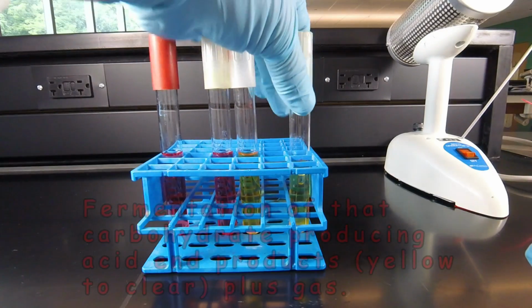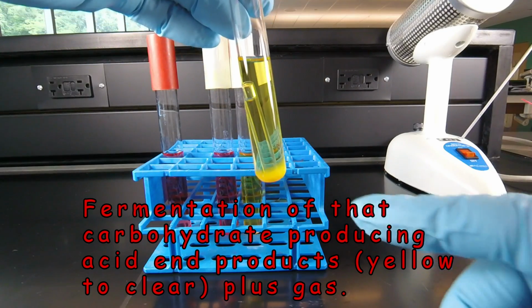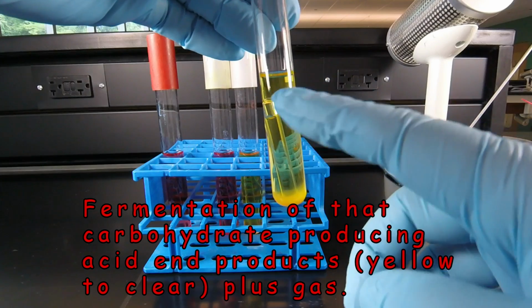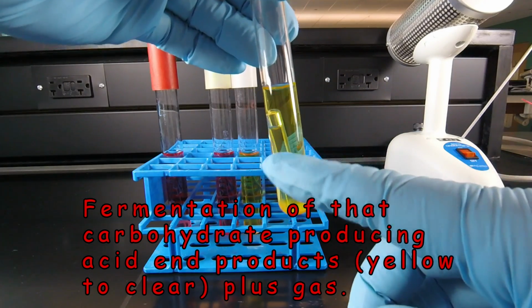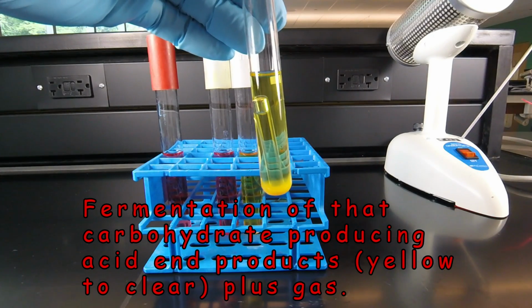And finally, we have fermentation with acid and gas. In this case, the Phenol Red has turned yellow, indicating acid, but notice up here we see a large bubble in the Durham tube, and that would be the gas. So this would be fermentation with acid and gas.